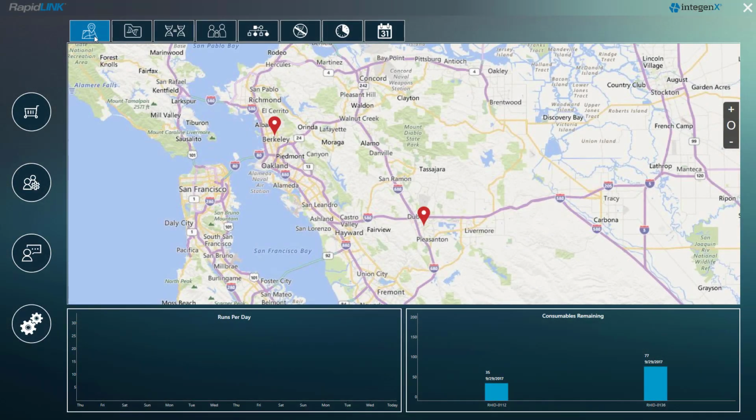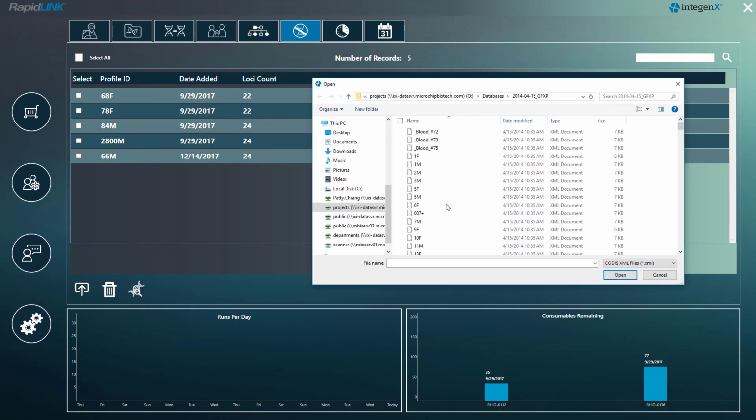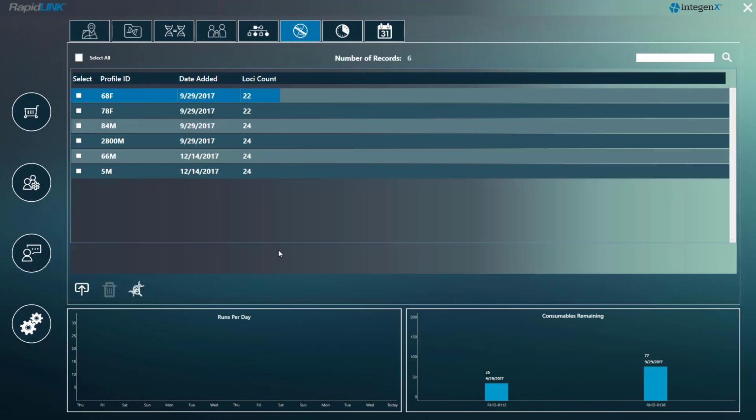In this video, I'll show you how to manage the staff profiles enrolled in RapidLINK Staff Elimination Database and what it looks like when there's a potential contamination event. From the RapidLINK Staff Elimination Database tab, we can see profiles that have already been enrolled in the database. To add profiles, click on the Upload button below. Likewise, if somebody has left the agency, you can remove their profiles with the Delete button here.